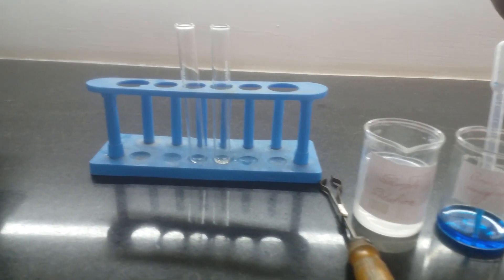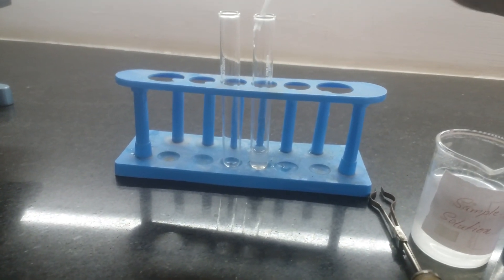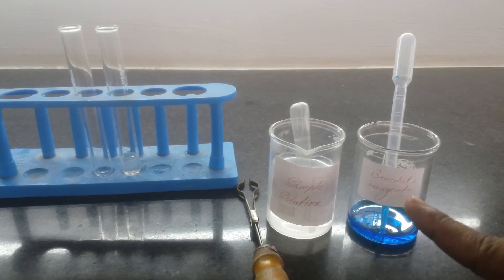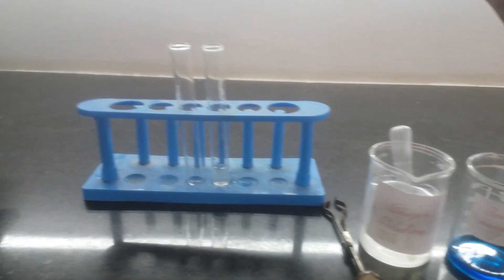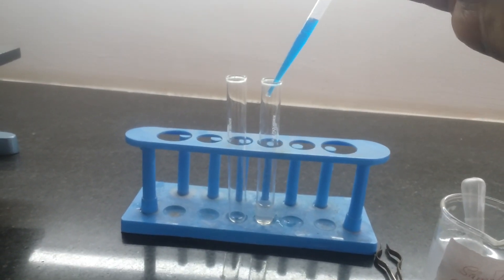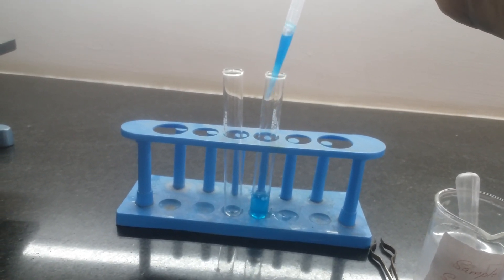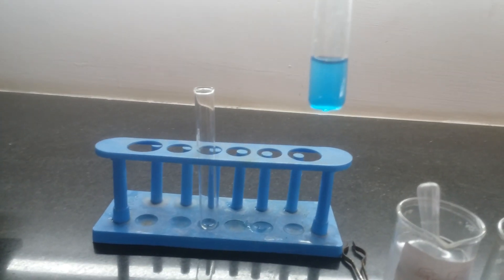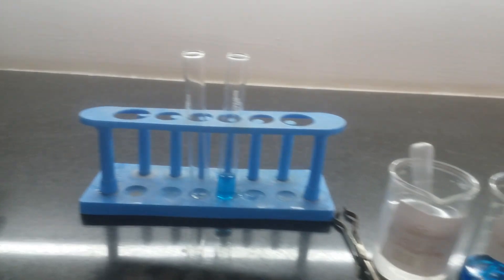Take around 2 to 3 ml of the sample solution, and add the Benedict's reagent in around equal volume. We can see initially it is blue in color.